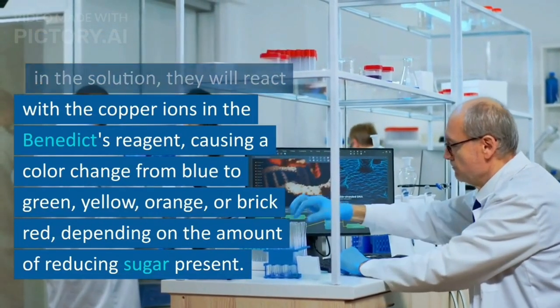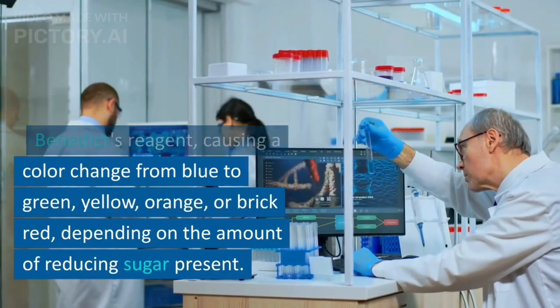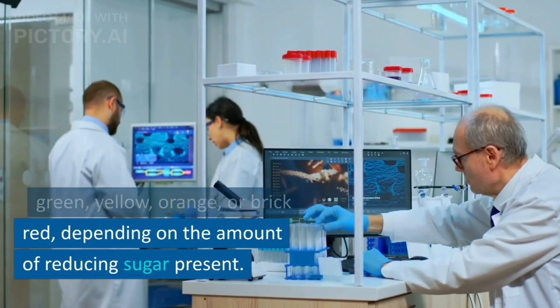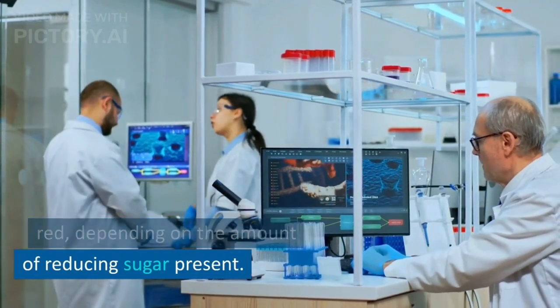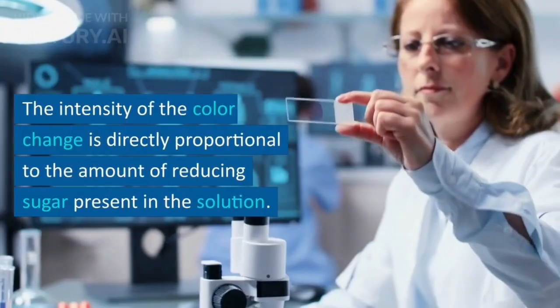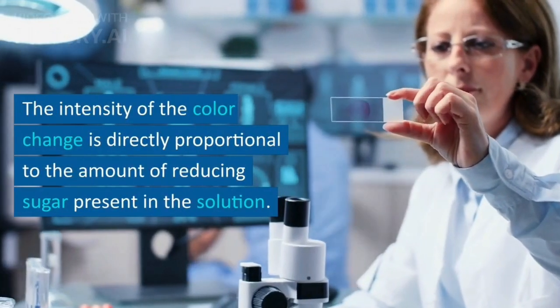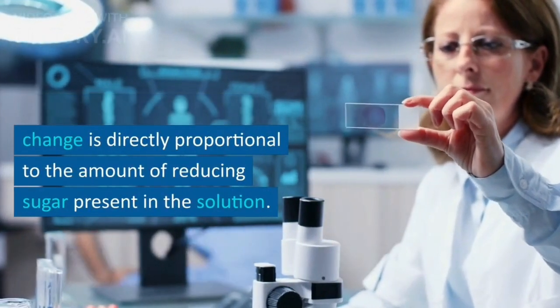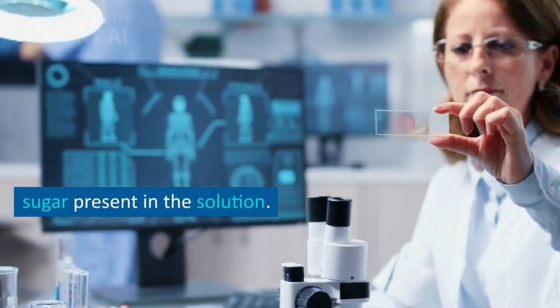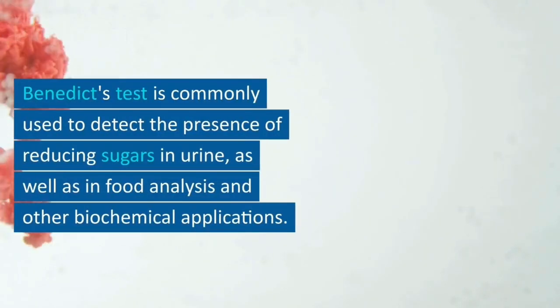The color change goes from blue to green, yellow, orange, or brick red, depending on the amount of reducing sugar present. The intensity of the color change is directly proportional to the amount of reducing sugar present in the solution.